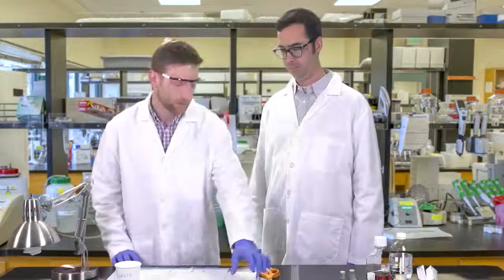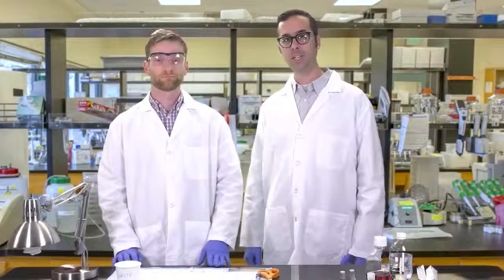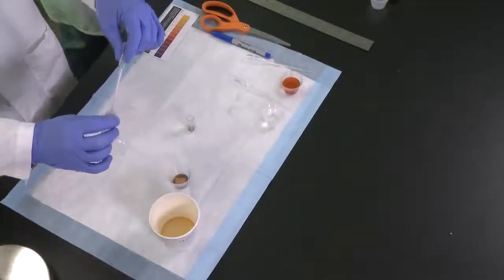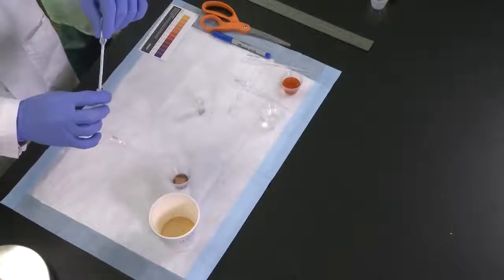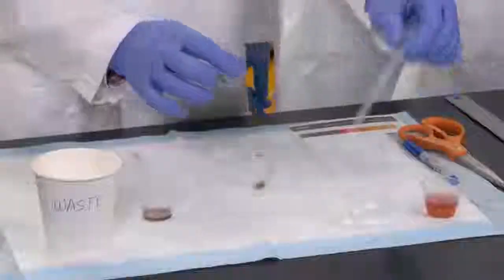So now we can add the CO2 indicator, right? Not so fast. First, remove any extra liquid in the cuvette. Then soak the beads in distilled water for five minutes.